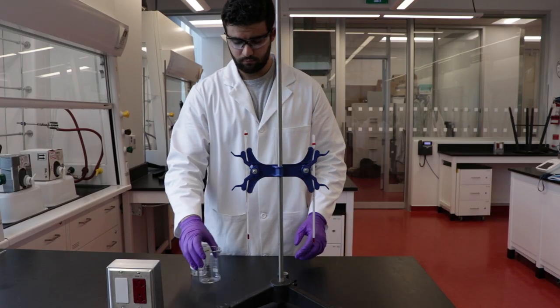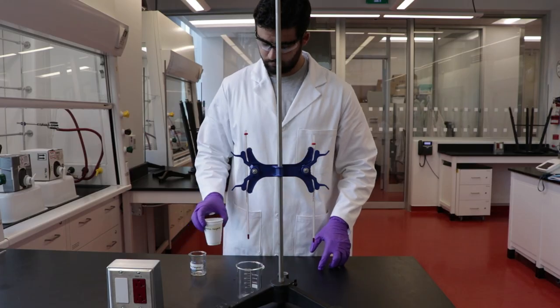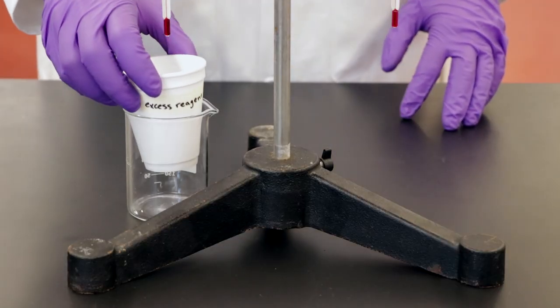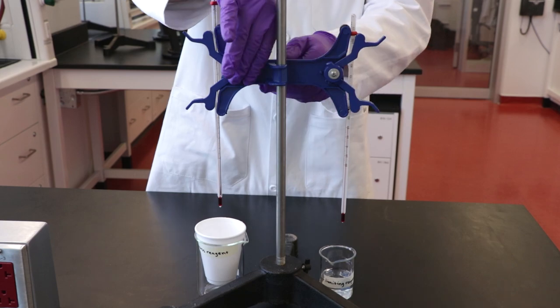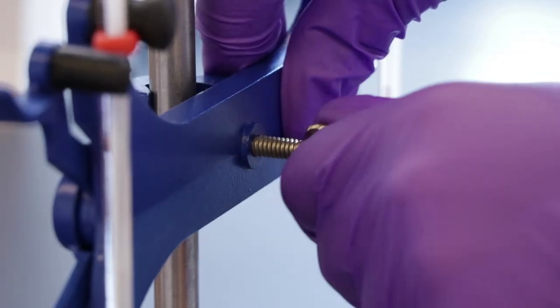Place both solutions beneath the thermometers. Adjust the clamp to lower the thermometers into the solutions.